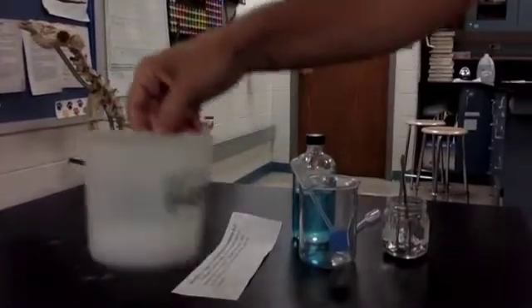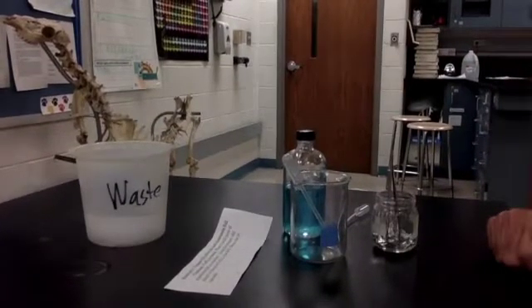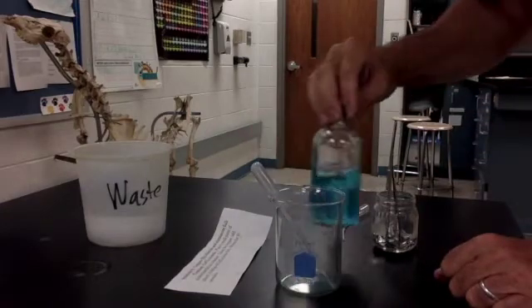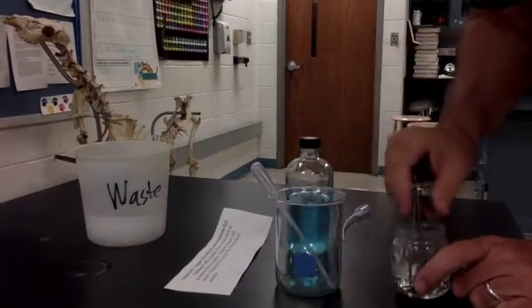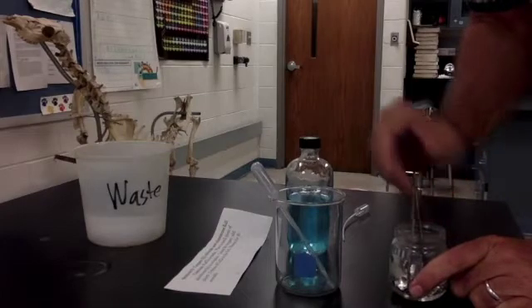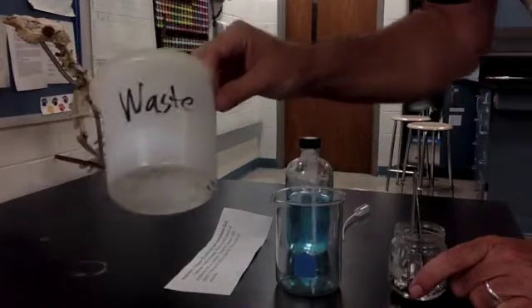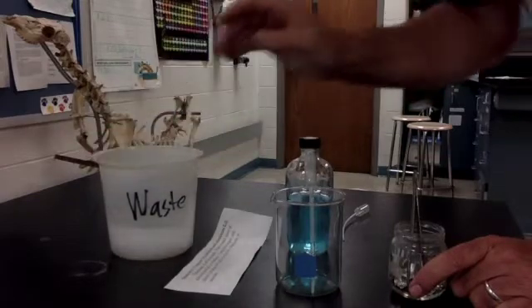Okay, finally, station 8. This is actually up at Mr. Davis's desk on the low counter near the door. So here we have a beaker to do the reaction in, a dropper to put the copper II chloride, this blue solution, on a small piece of aluminum. Now when you're done, you want to wash all the chemical that's in the beaker there after you've seen the change into this waste jar. So we're not washing it down the sink, we're not throwing it away, we're putting it in this waste jar.